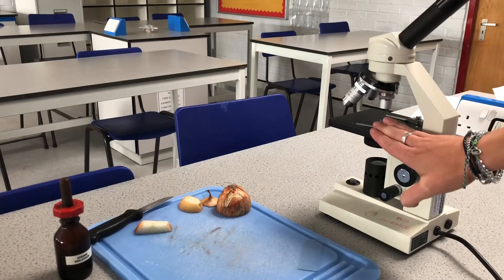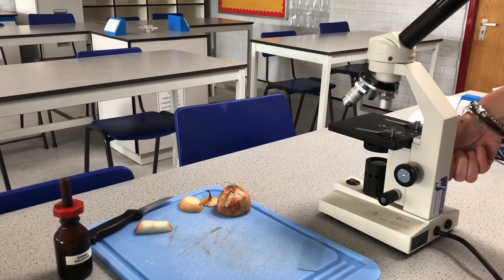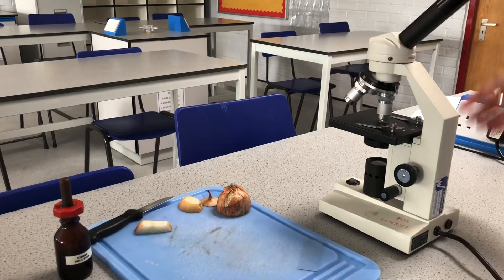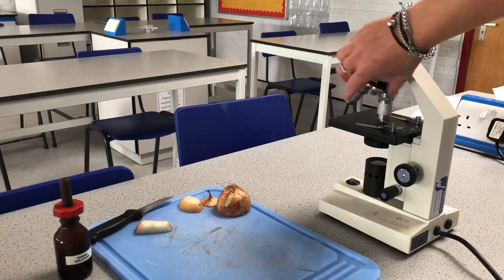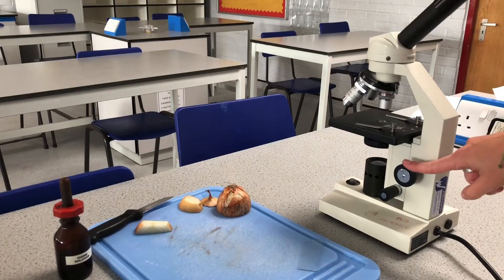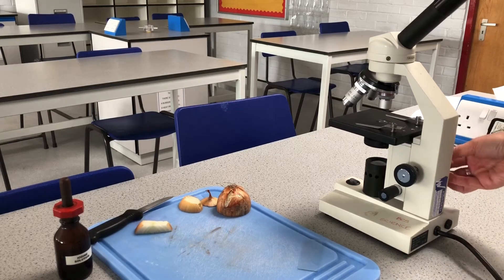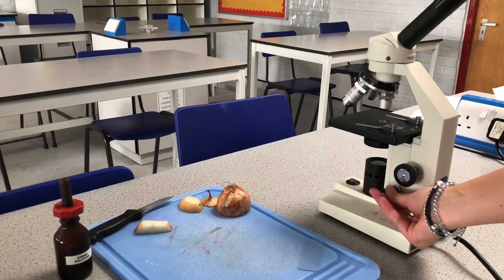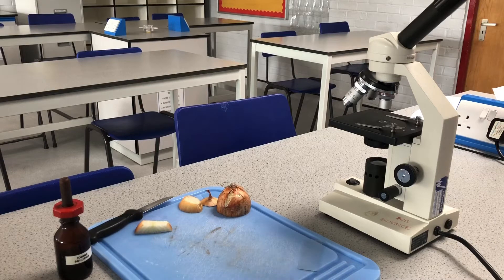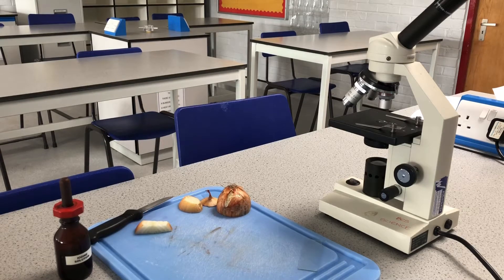We start with the stage — that's where we put our sample to look at it. We lower it down rather than raising it up, because when you use a big objective lens and raise it up you are in danger of cracking the slides. So we start with the stage as high as possible and lower it down. We have a coarse adjustment knob for big movements and a fine adjustment knob to help focus at the end.